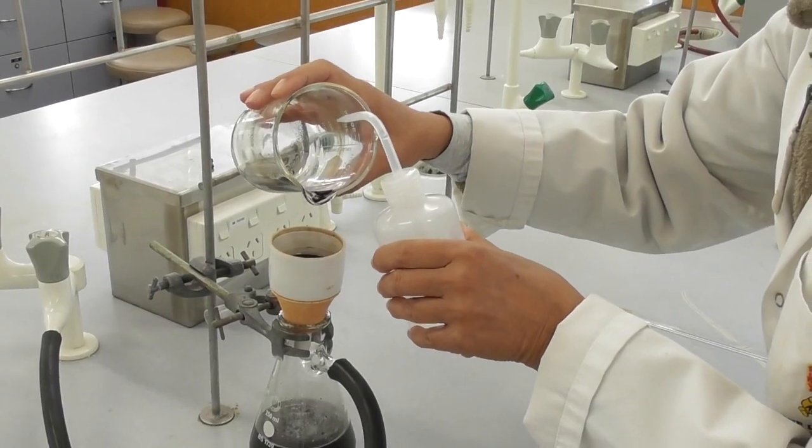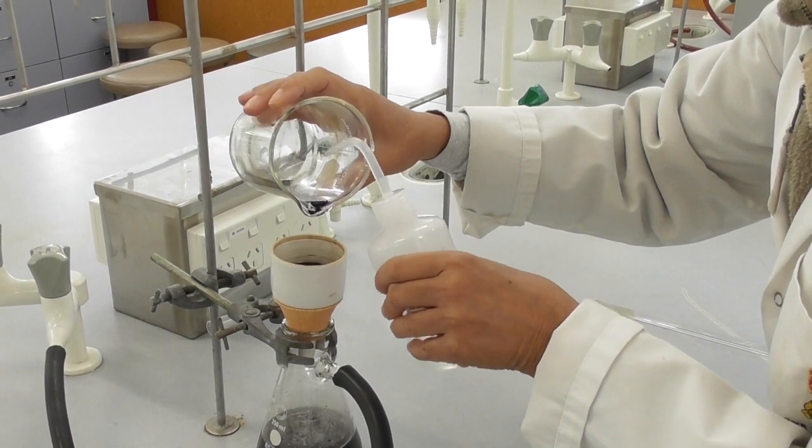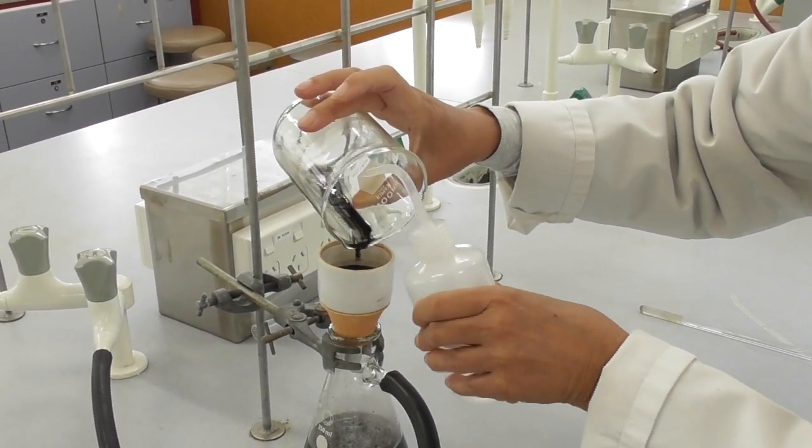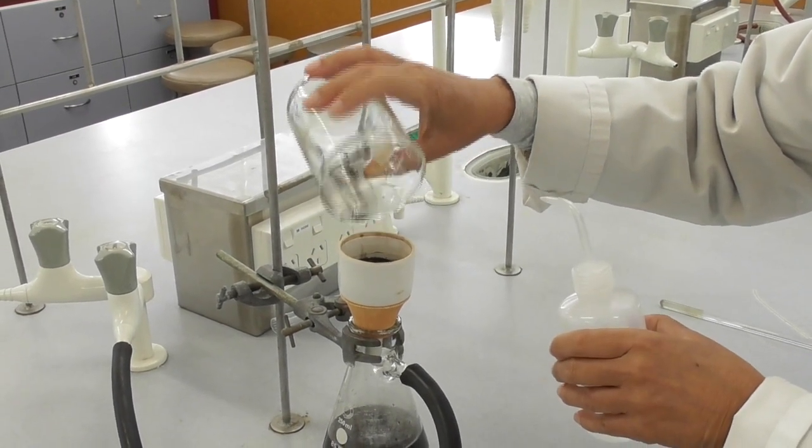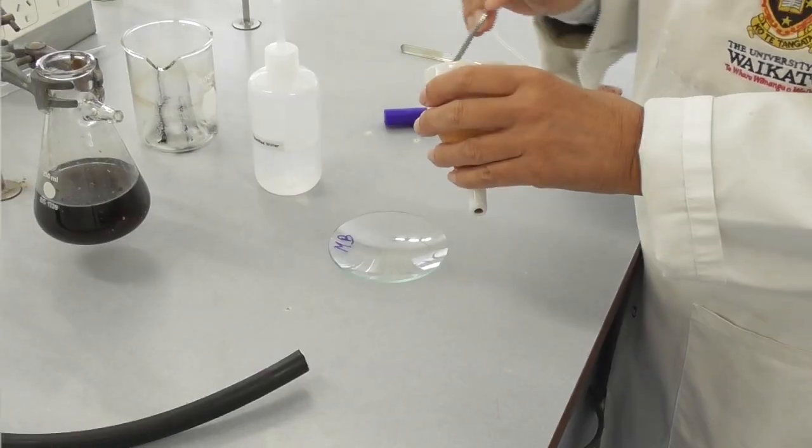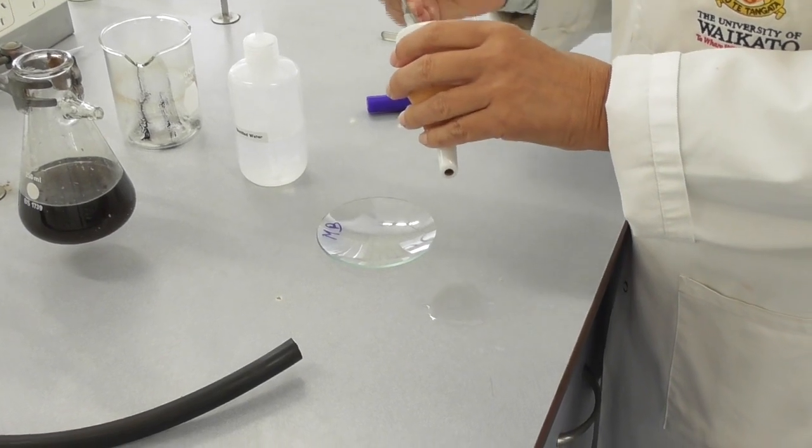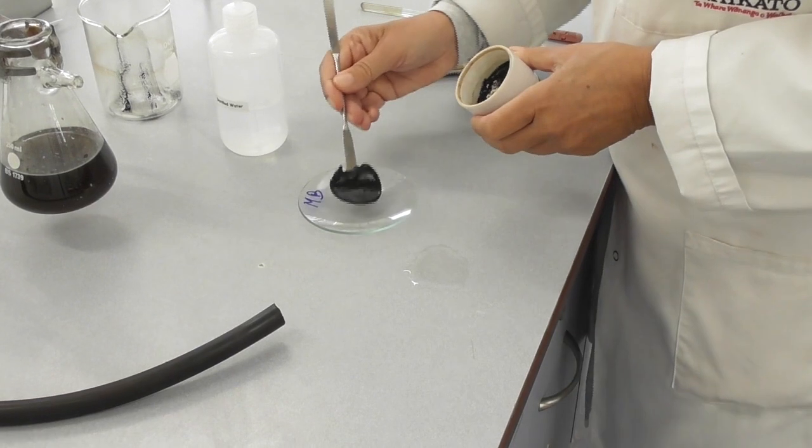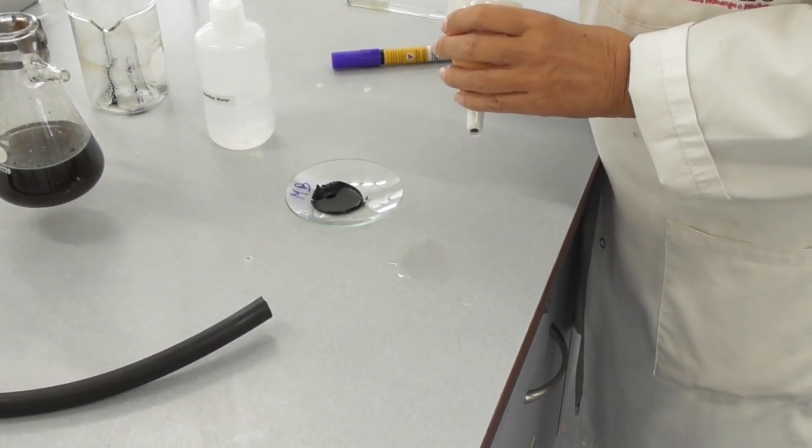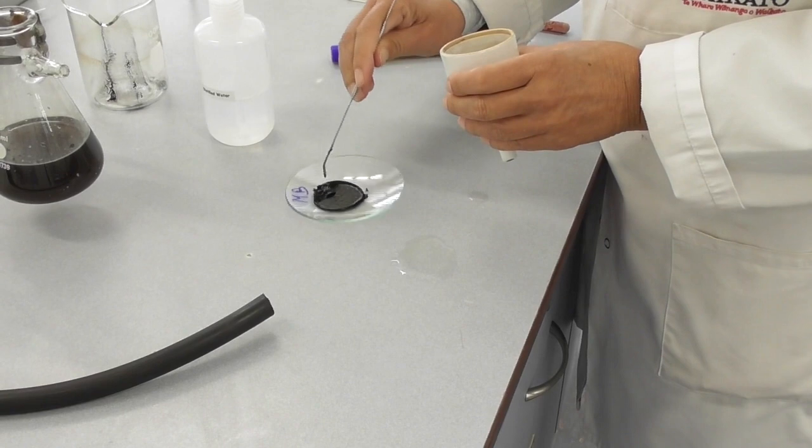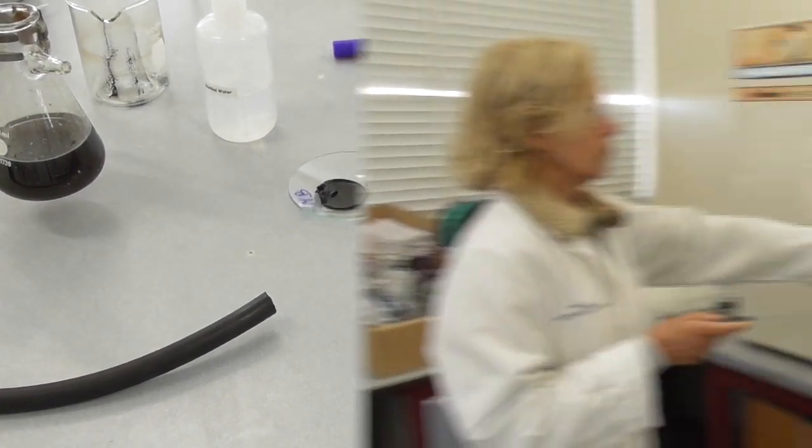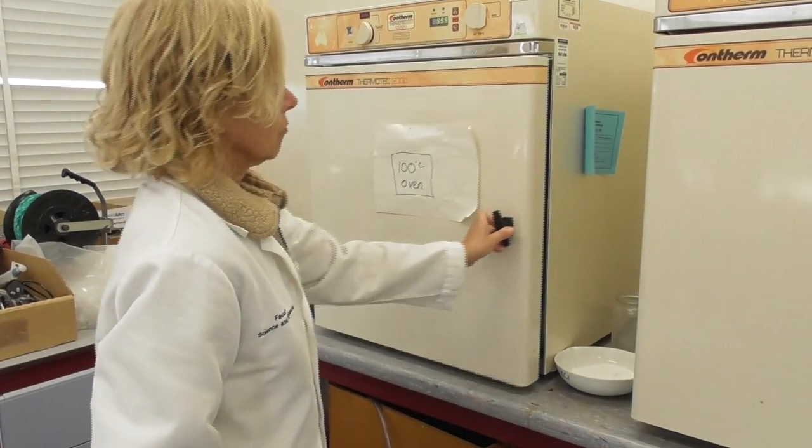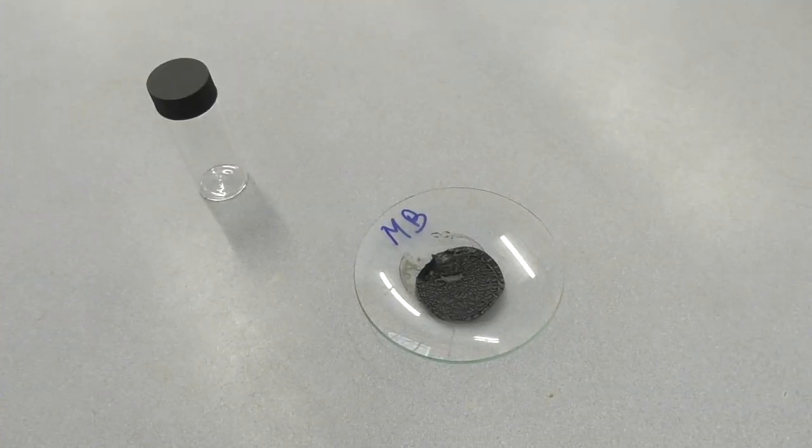The last little bit will be transferred with a little bit of extra distilled water. This is enough for the transfer and also for washing the product. Once all the solution has run through the filter, I remove the product together with the filter paper and put it onto a watch glass. This gets put into a 100 degree oven for 10 to 15 minutes until it's dry.